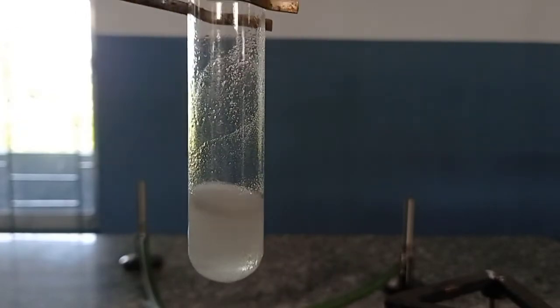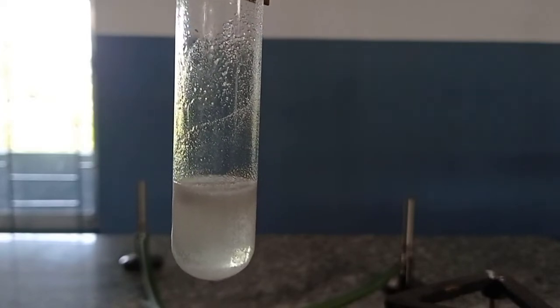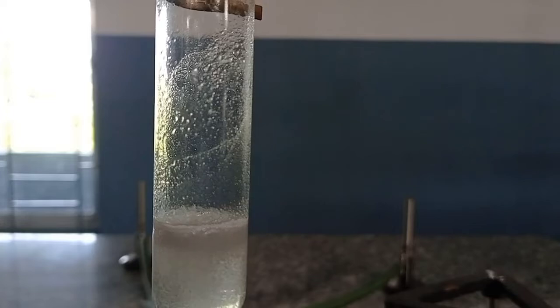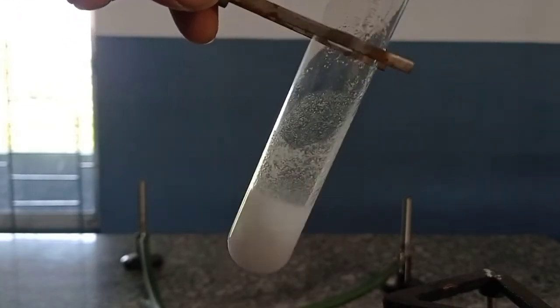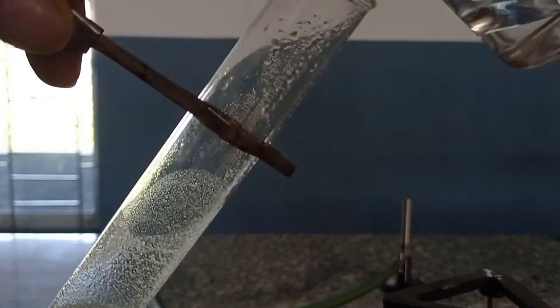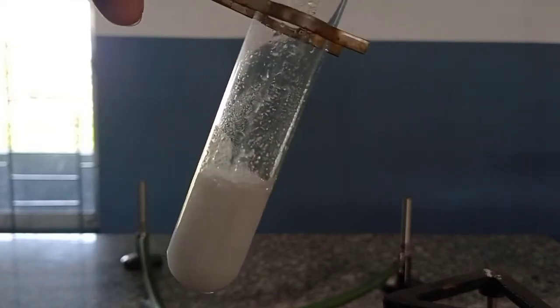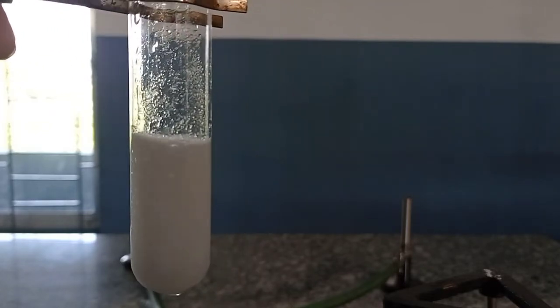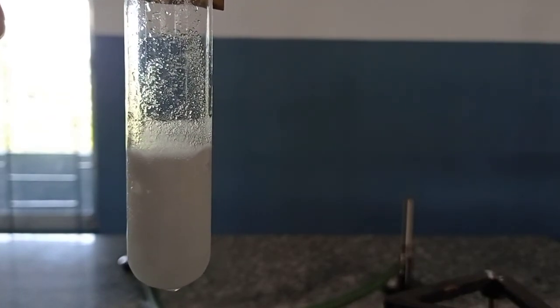I hope through this demonstration you understood the concept of effervescence. Let me summarize quickly: I prepared a sodium bicarbonate solution, added acid to it, and you can see there is formation of effervescence. Effervescence means the release of gas in the form of bubbles during the course of a reaction.